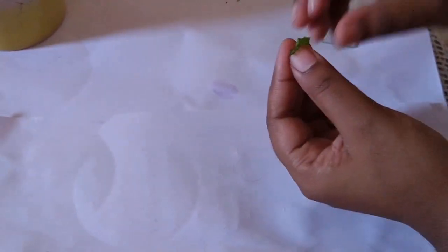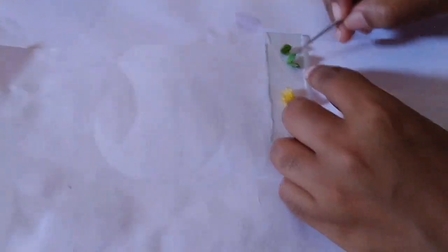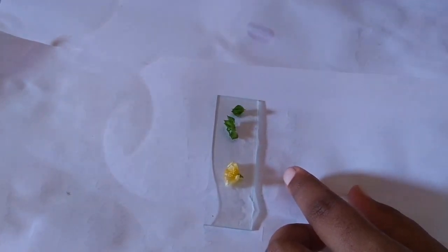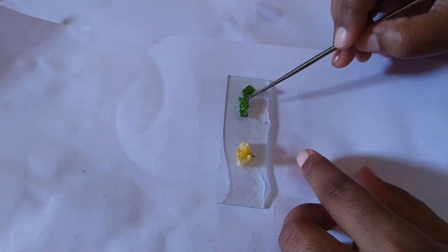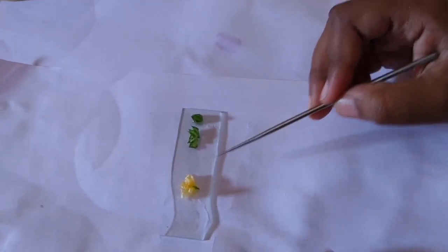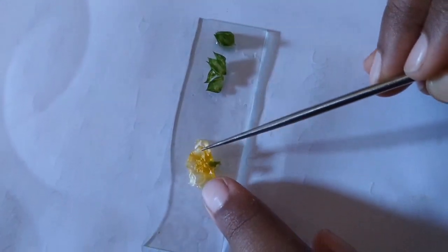That is the whole calyx, and that is the opened-up calyx of Sida. The number of sepals are 5 in number. On the right side is the whole calyx, and that is the opened-up calyx. Here is the corolla, or the petals of Sida.